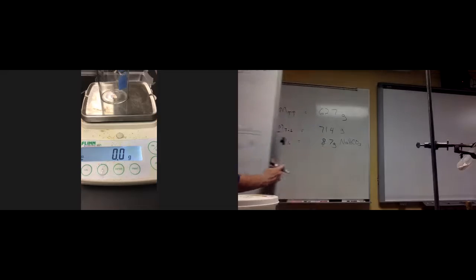I'm given that I started with 8.7 grams, oh, I wrote G, of NaHCO3. Now, where'd that come from? I calculated it. Right, we did it right there. We said the test tube itself is 62.7, the test tube and the sample is 71.4. Subtract those two, I got 8.7 grams of sodium bicarbonate.